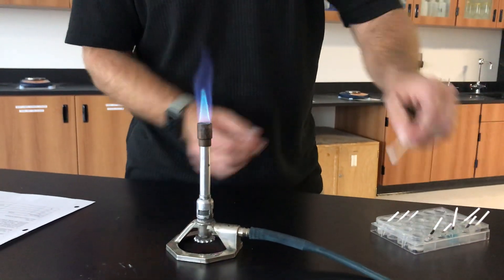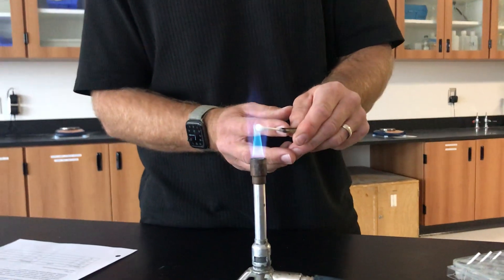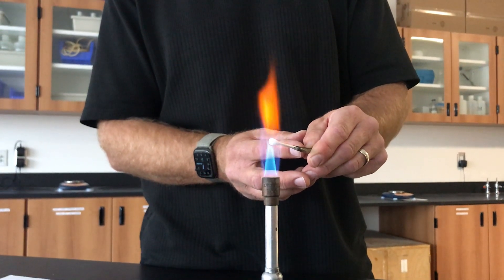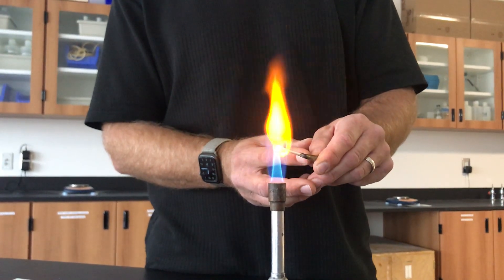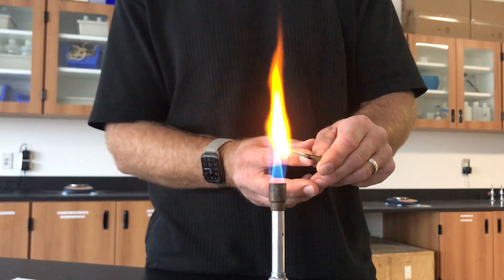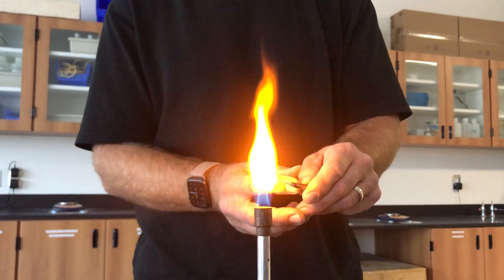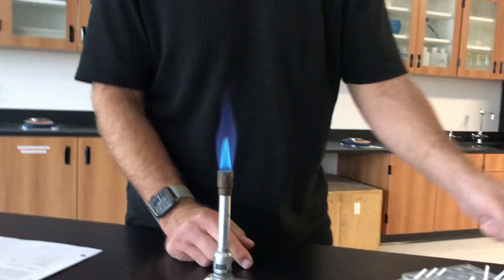Now we're going to move on to sodium — two more to go. Here comes sodium. That's it right there. There's our sodium color. We're just going to let that go because that's perfect. There we've got our flame test for sodium.